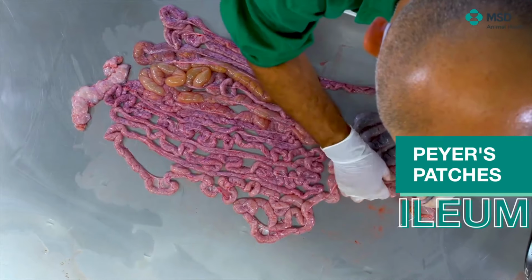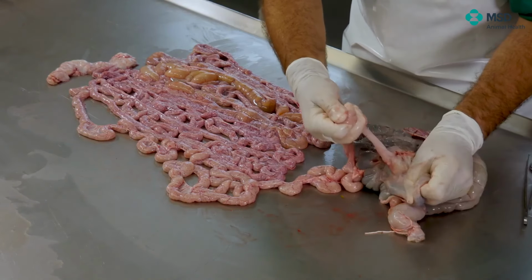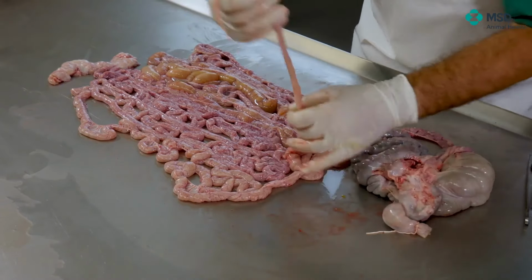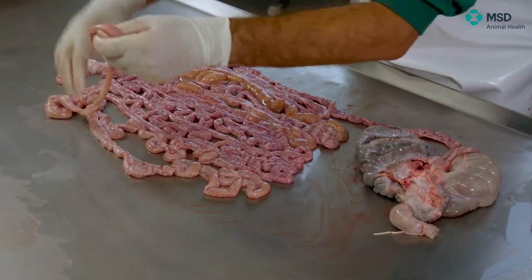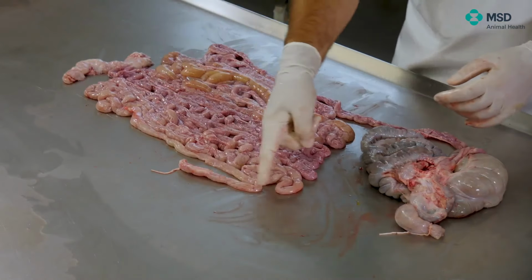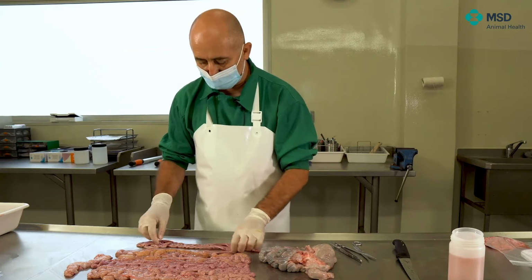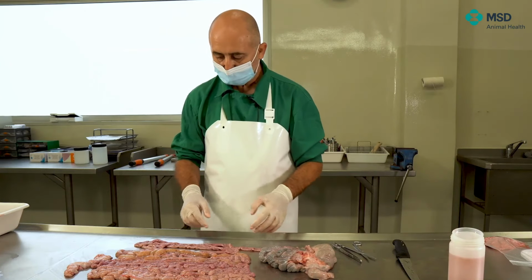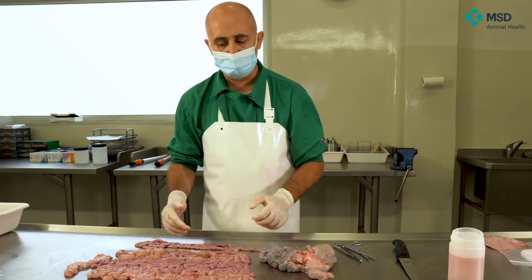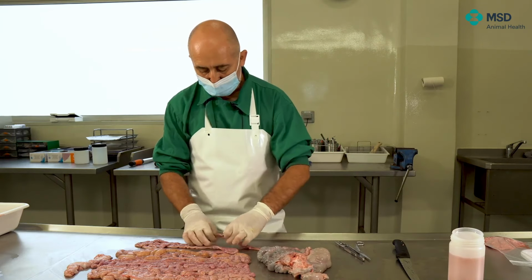Of course, we might be interested in bacterial isolation, not for Lawsonia intracellularis, because at the very end, for Lawsonia intracellularis, we are detecting it especially by PCR. PCR sometimes in feces, but it could be, of course, PCR on ileal content. But it can also be detected by immunohistochemistry. So it could be interesting to take a sample for, in this case, histopathology and further immunohistochemistry. Then we will take a sample to fix in formalin.